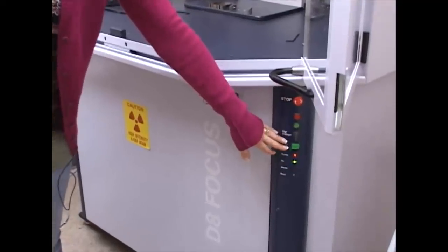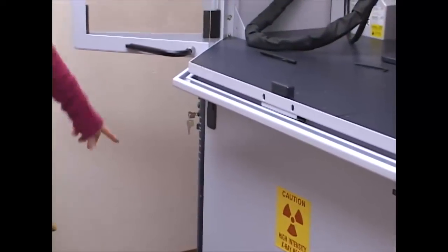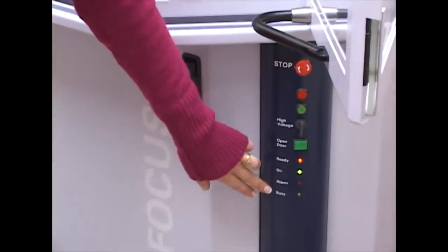And then there is also electronic switches in the door in the bottom and the top. What this does is ensures that when you close the door, all the switches have engaged correctly and that the door is correctly closed. If the door is not correctly closed, it will cause the safety circuit to trip and it will shut everything down. There is a control panel here and the exact same set of control panels over there. And there is LED lights that are ready, on, alarm and busy.